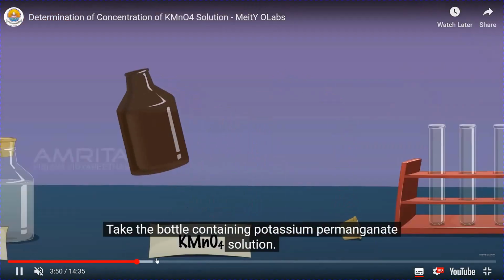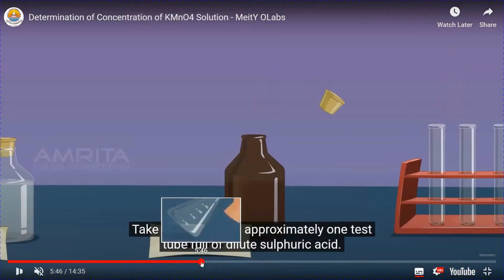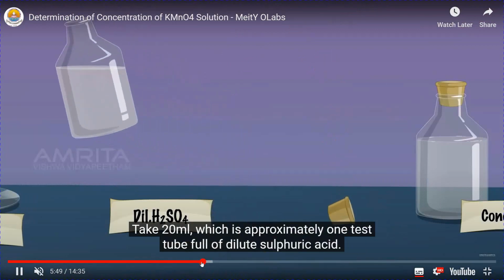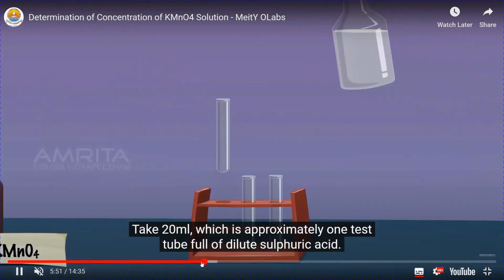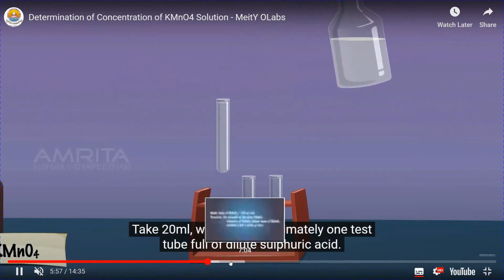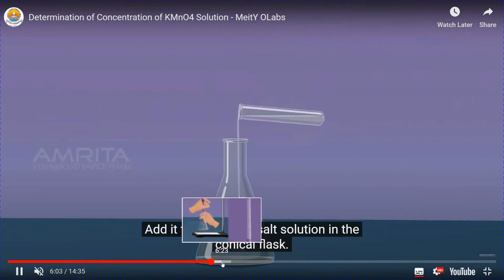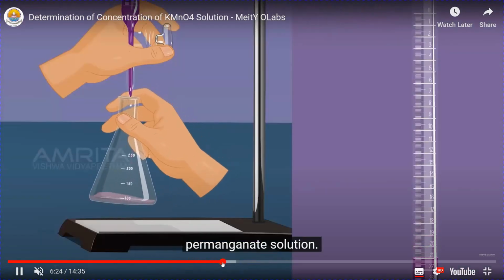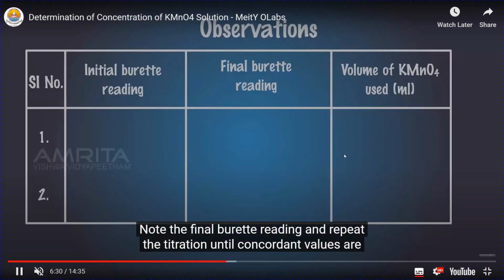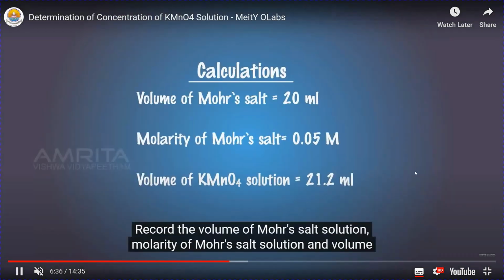Fill the KMnO4 in the burette. Dilute H2SO4 you have to add in the conical flask. So dilute H2SO4 is taken after taking the 20 ml of FAS. And the titration is going on. And this is the final reading you are obtaining here, and the volume of KMnO4 used.